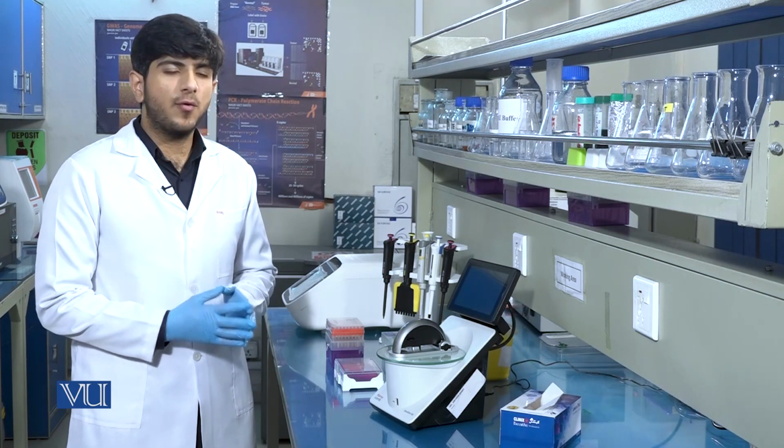While performing the experiment, first of all, we have to turn on the NanoDrop instrument.